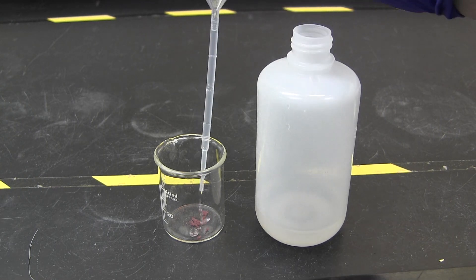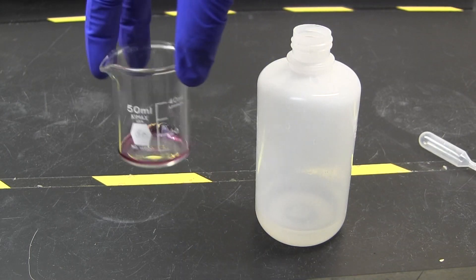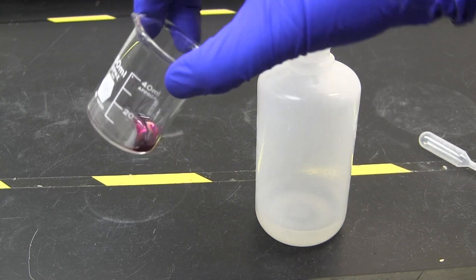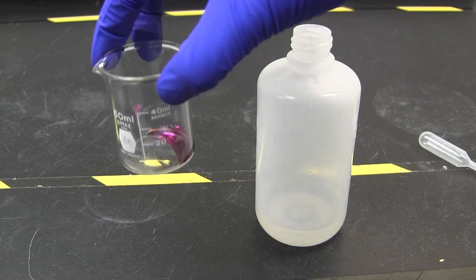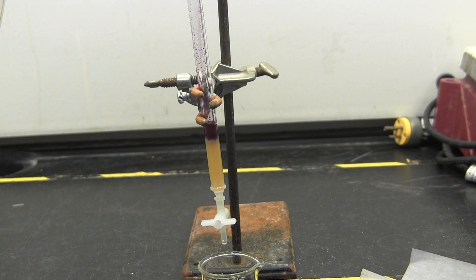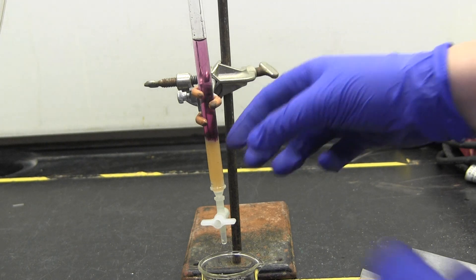Then, dissolve your weighed-out sample in one milliliter of water and add it to the column. If you cannot dissolve your sample, try crushing your sample up with a stirring rod or using more water. Then add it to your column.